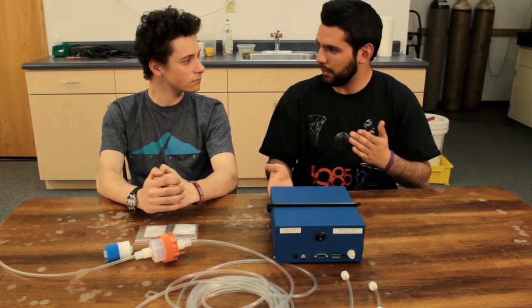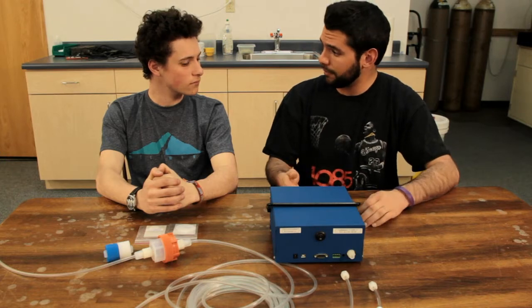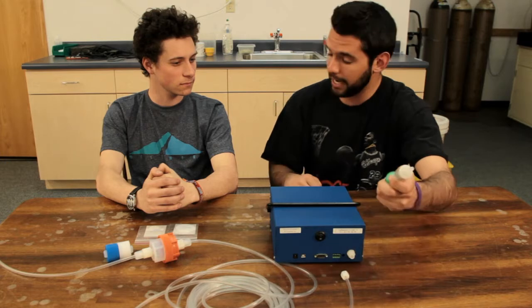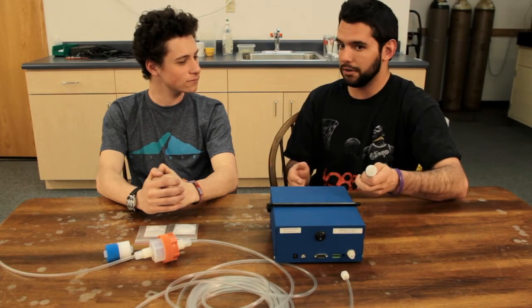So over time, the ozone monitor is going to develop an offset. It's going to be plus or minus, whatever it is, it develops an offset over time. And the way that we account for that is by zeroing the monitor. The way that we zero the monitor is by attaching the ozone scrubber. The ozone scrubber is what destroys ozone going into the monitor.